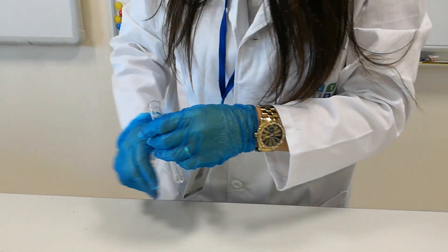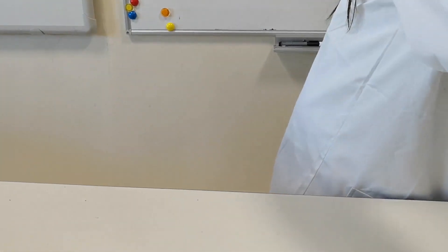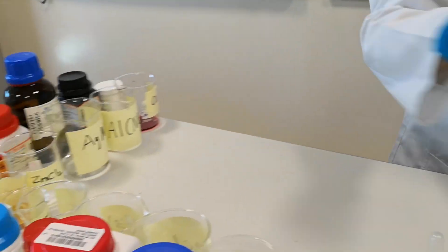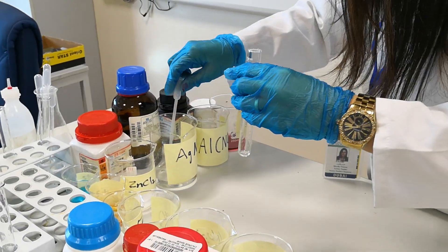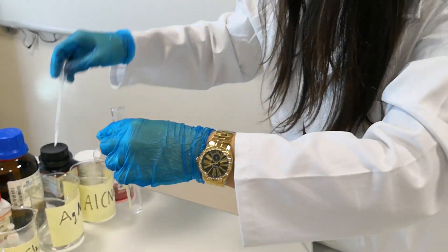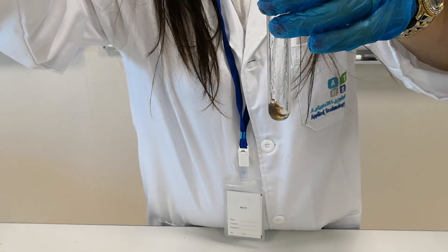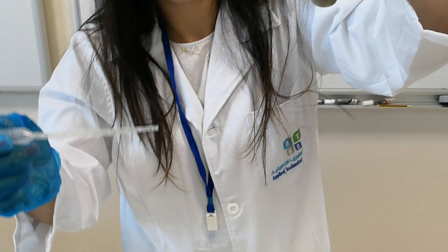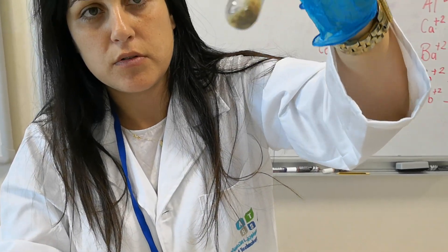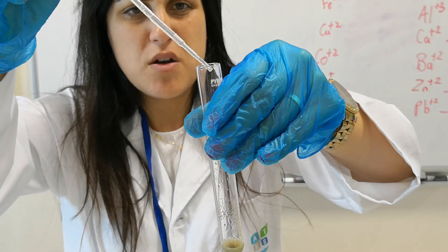Now we will try silver. This is a solution of silver. Adding sodium hydroxide — it turns brown, then brown to gray.